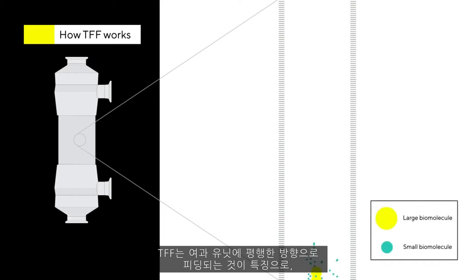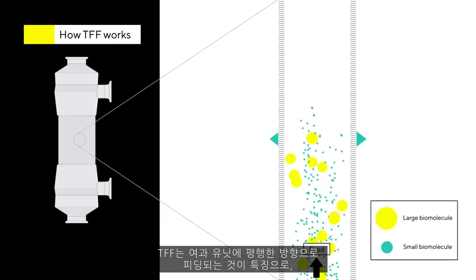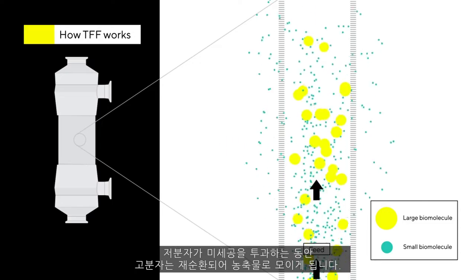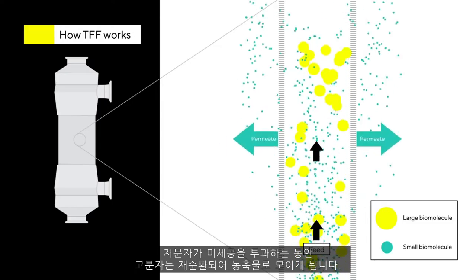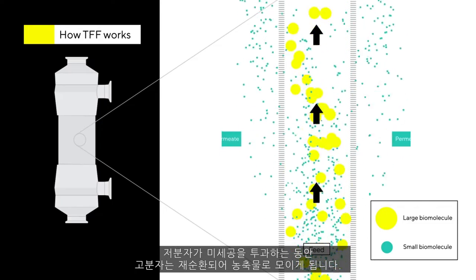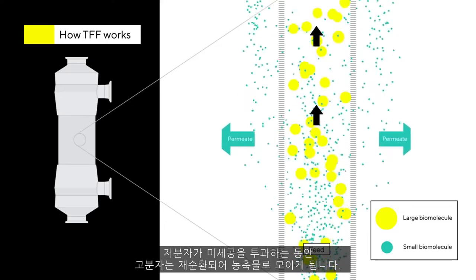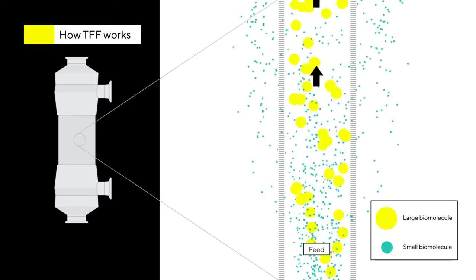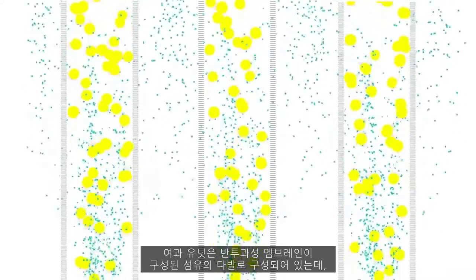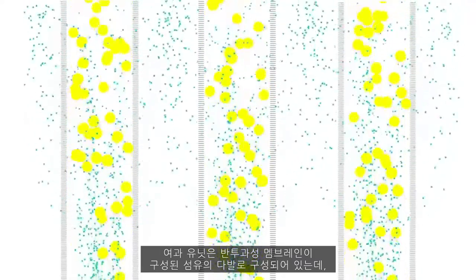In a TFF setup, the feed stream flows in parallel to the filtration unit. Smaller molecules pass through the pores as permeate, but larger molecules get recirculated back to the retentate reservoir. Imagine that the filtration unit is made up of many individual fibers, each consisting of a semi-permeable membrane.